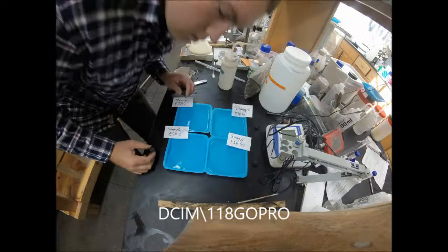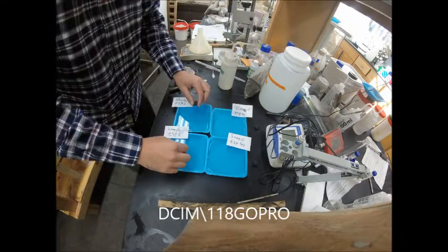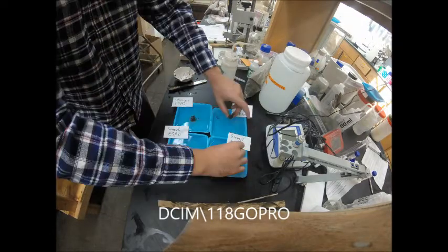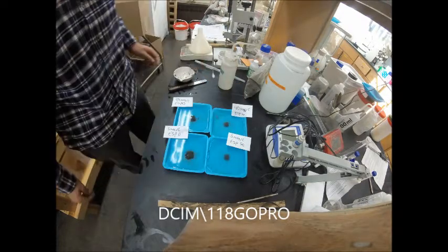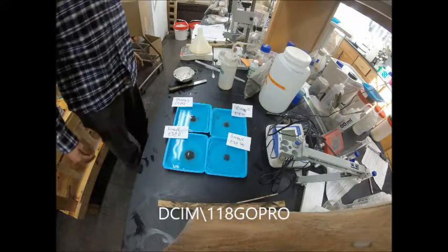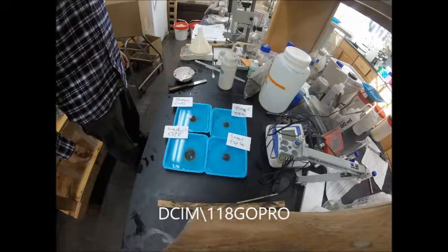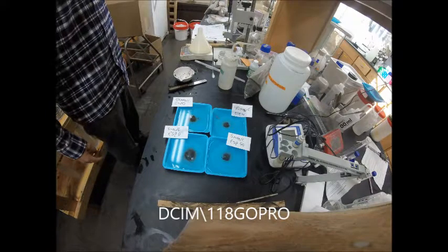This is a method to measure soil dispersion using a small cube of soil that was moistened to form into a small cube shape. The chunk of soil is then placed into deionized water, where it is allowed time to slake initially, and then it disperses.